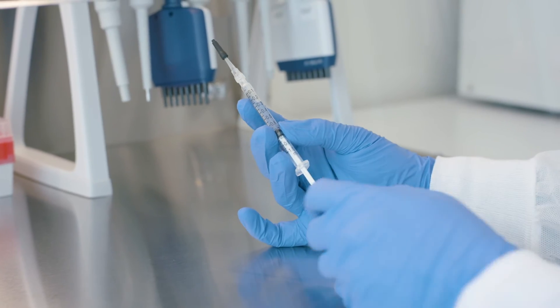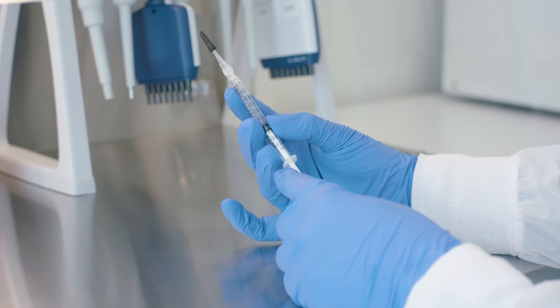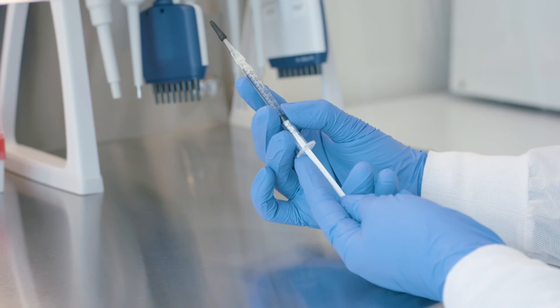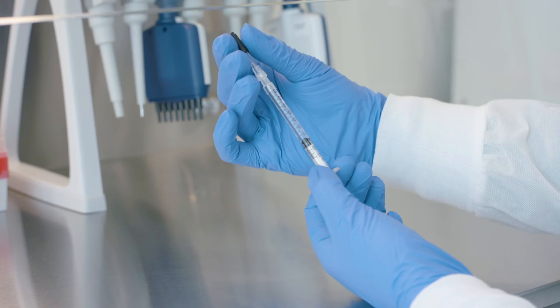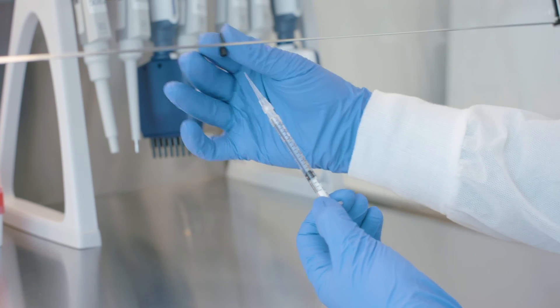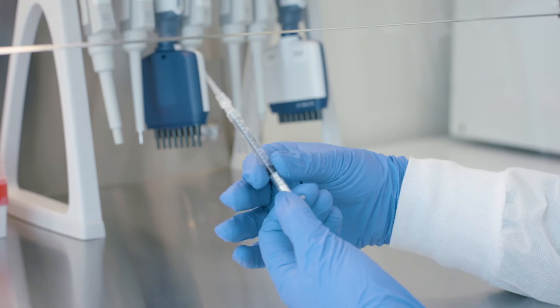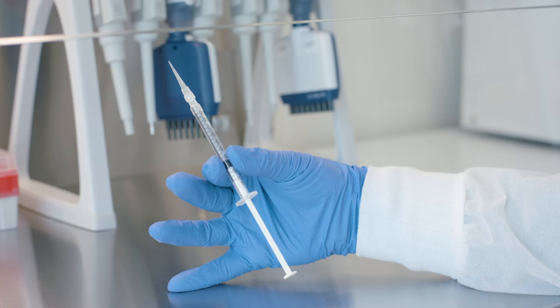Hold the syringe firmly in one hand with the tip facing up and away from the chip. Pull back on the plunger slightly to create negative pressure, and remove the shipping cap with the other hand. Be careful when removing the control line fluid syringe cap to prevent drips.